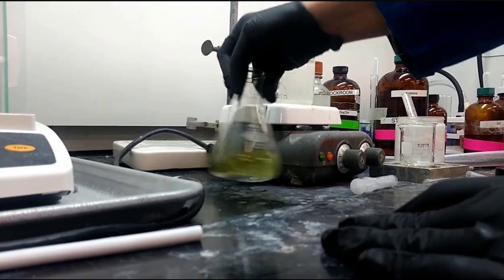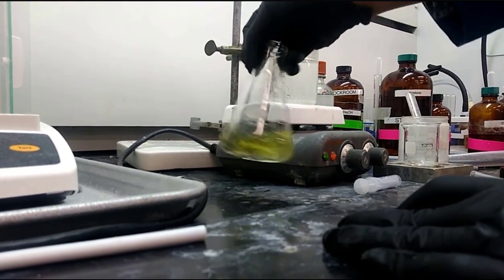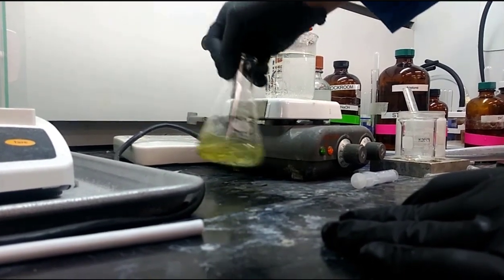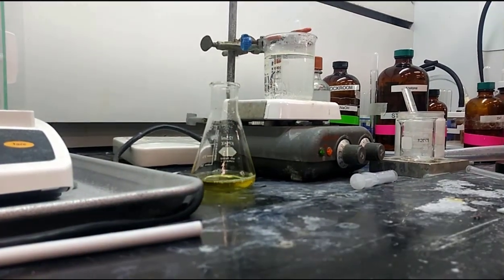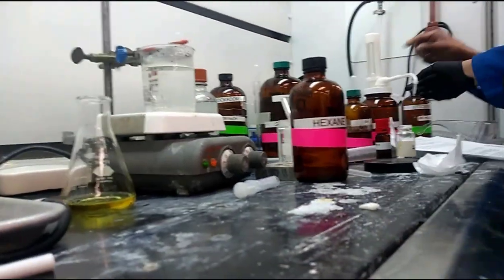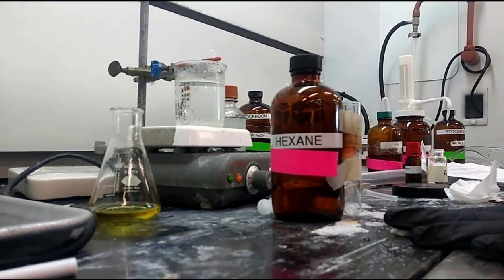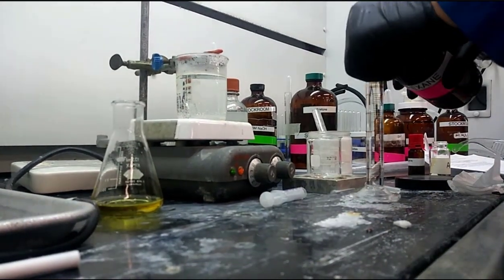So now when they get ready to do their extraction with hexane, that alcohol is going to prefer an organic phase, hexane, over the aqueous phase. Right now you can see that they are vigorously shaking it. Shake it like a Polaroid picture. But you can see now they're finished. They shook the potassium carbonate until it was completely dissolved. And now you can see that they're getting the hexane bottle. Pointy point point. There it is. All right. Yeah, look at that pretty pink little label.